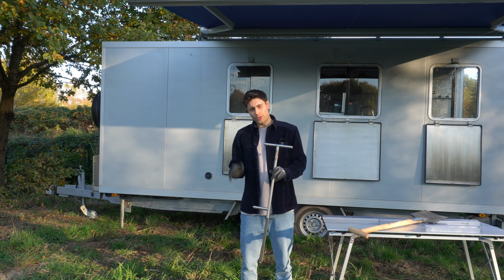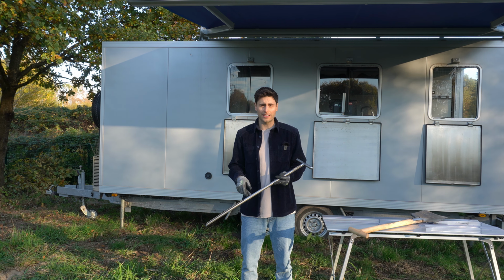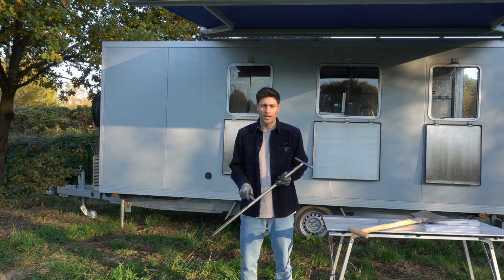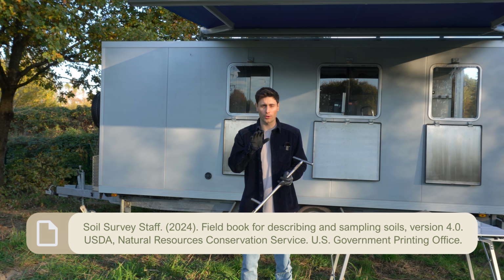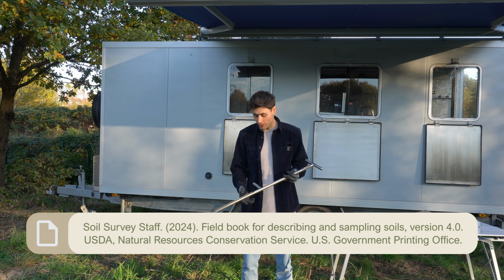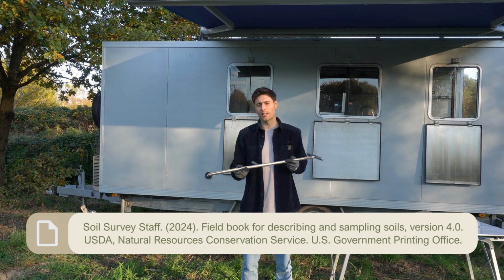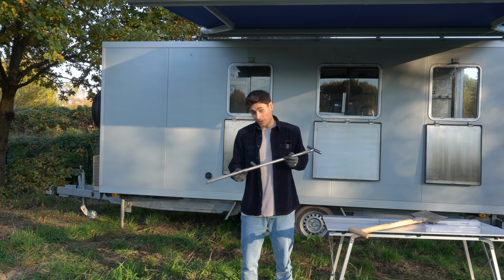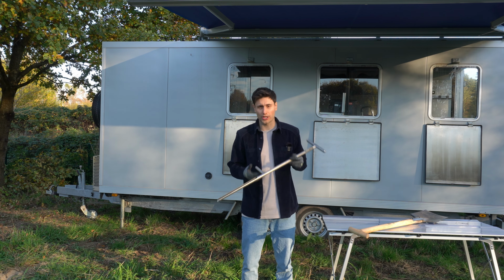There are other tools specifically made for soil sampling, for example, augers, and the best tool depends on the soil type and your scope. A very nice overview is provided, for example, in the field book of the US National Soil Survey Center. For the topsoil sampling that we are going to show you today, the regular push-in soil probe is sufficient. But there might be situations in which you don't want to invest in specialized tools.